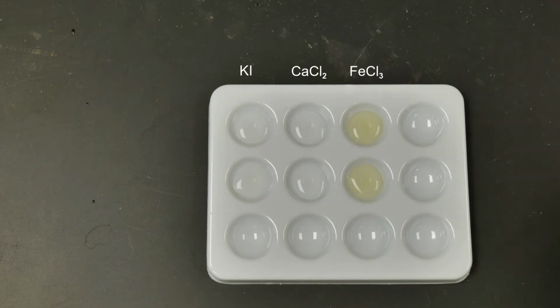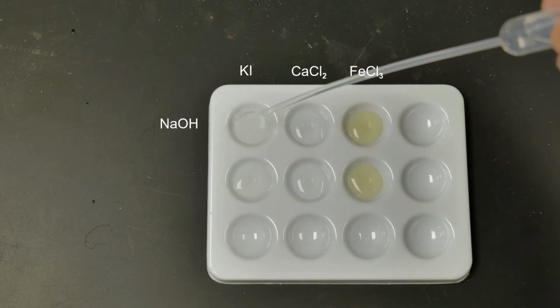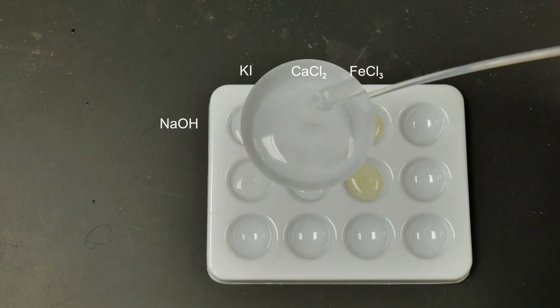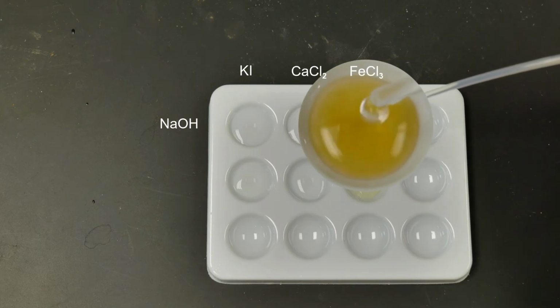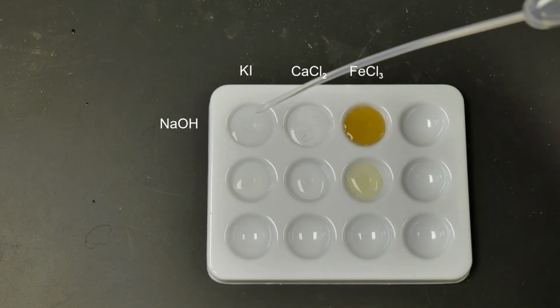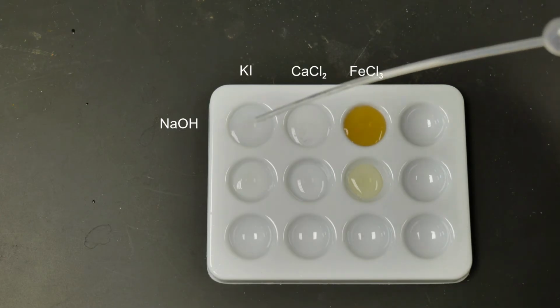All right, so we're going to add in some sodium hydroxide now into this first top row. So this first one, we have sodium hydroxide with the potassium iodide. Do we see any kind of reaction happening? Then we have sodium hydroxide now with calcium chloride. Do we see any kind of reaction? And lastly, sodium hydroxide with the iron 3 chloride. Do you see any kind of reaction? So again, make some observations, write down on your sheet if you see any kind of change occur, and we'll make note of it.